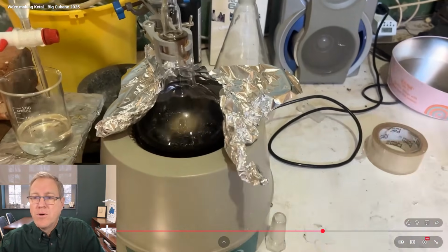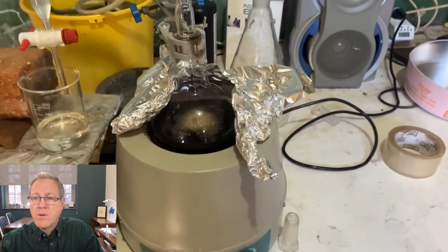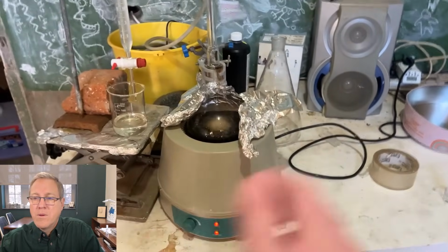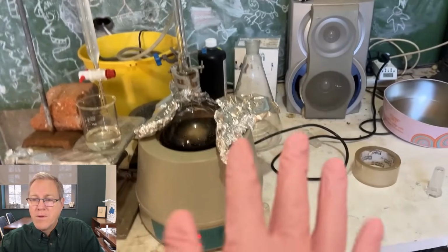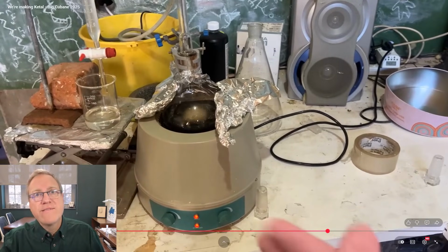Both of those dissolve in water, but our end product doesn't. Maybe we'll remove some of the tar, we probably won't. And then we'll set up this vacuum distillation. Just because once again, I'm not very confident about my vacuum distillation. So if we have a whole heap of mixtures, theoretically we could just put it through a column and carefully distill our product and chuck away everything that we don't want. But doing a washing step before then lets us remove a lot of the stuff that we don't care about.